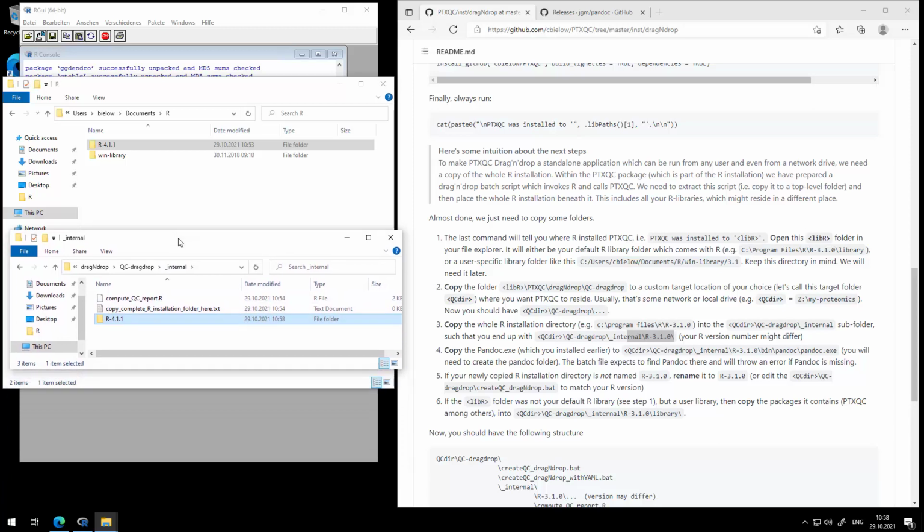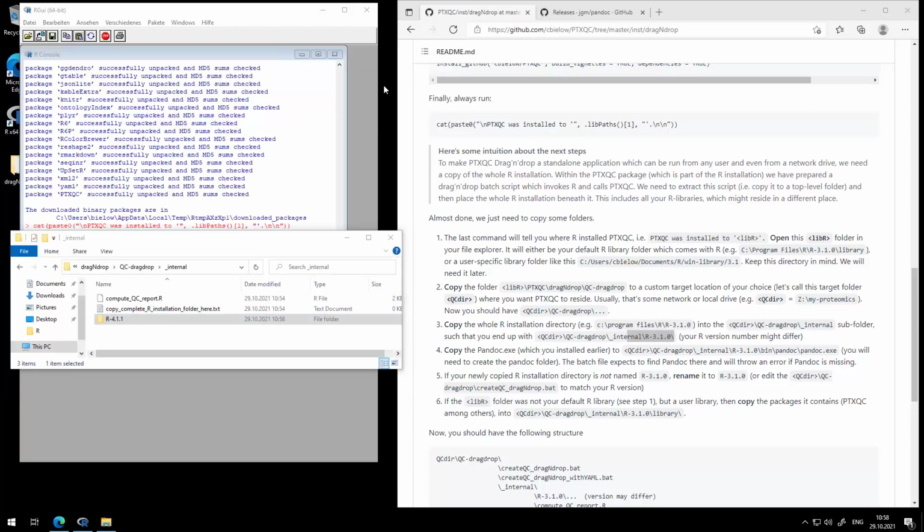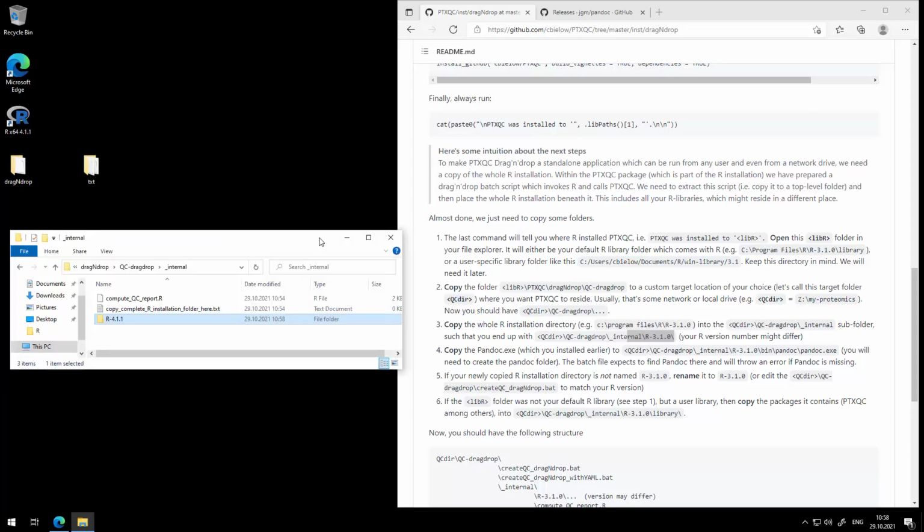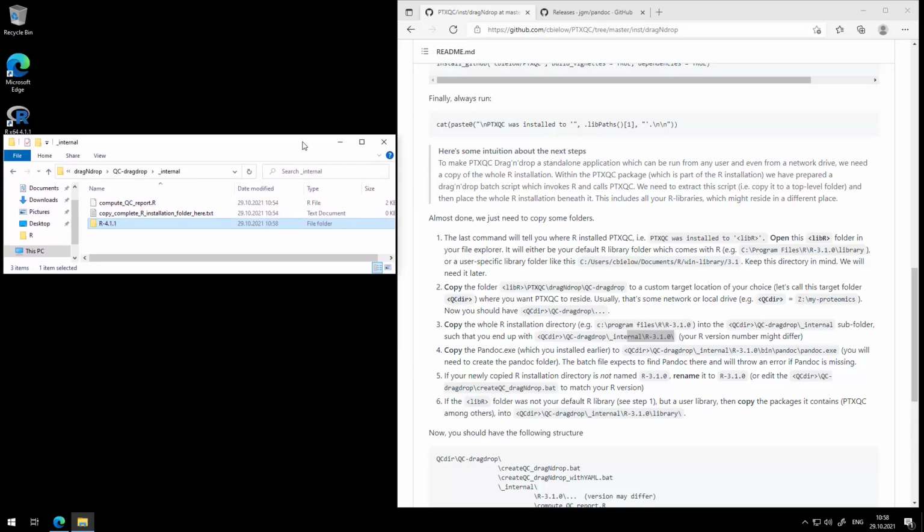Now we don't need the original R installation anymore. You could even uninstall R at this point if you wanted to. We have everything we need.